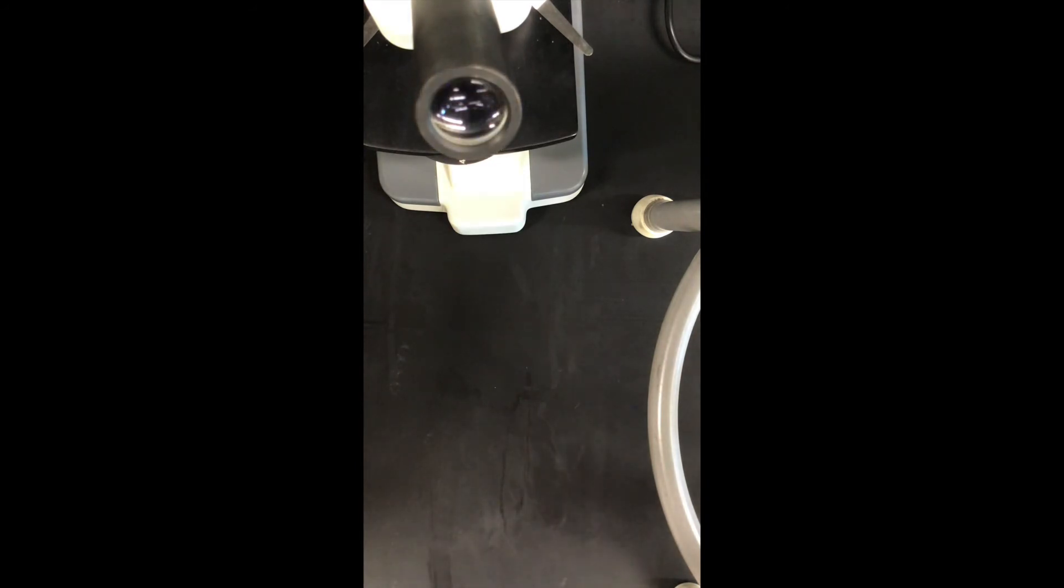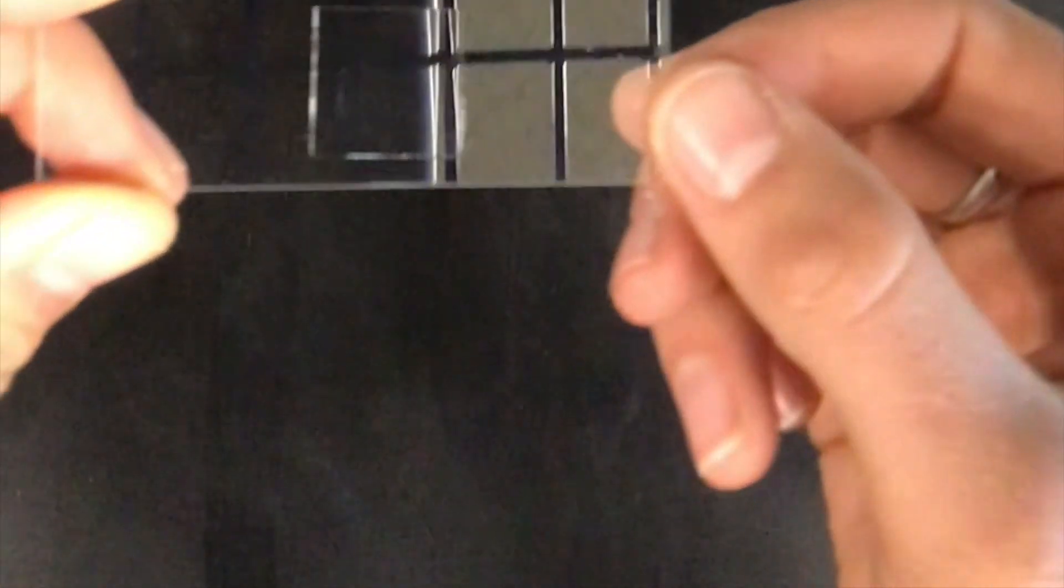Well that's why I have two. Okay so I've got my strand of hair here on the slide and then I'll put my slide cover right on top. Perfect. Look at that. No air bubbles. You can see the strand of hair. So let's look at this one under the microscope.